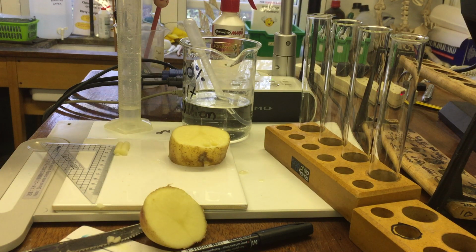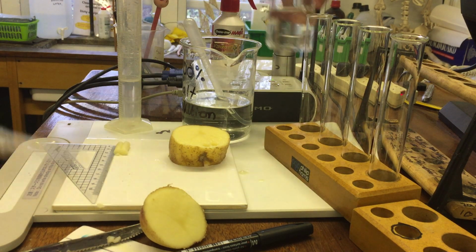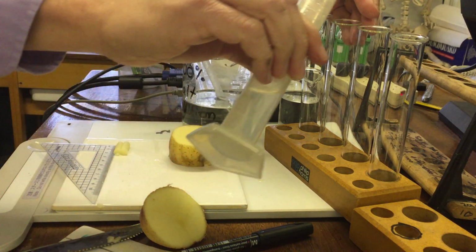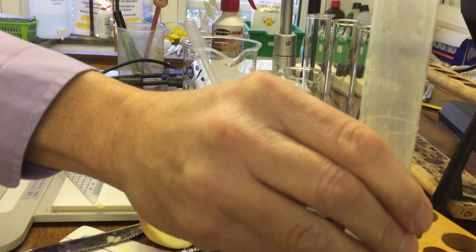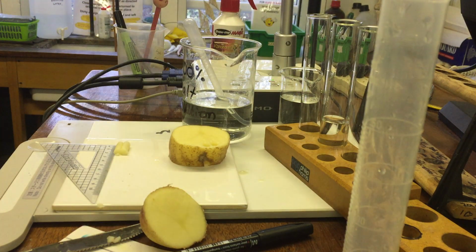Okay, so I'm going to top that up to 20. I'm only going to do one. So this one is going to be our 25% salt solution. Okay, put that in and make sure you've labelled the tubes. So use your pen to label them 0, 25, 50, 75 and 100. Okay, and you can put an initial on them as well. Once you've got them all done, you're ready to start the experiment.